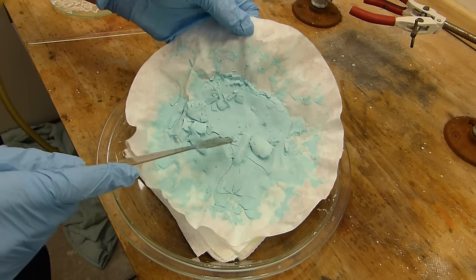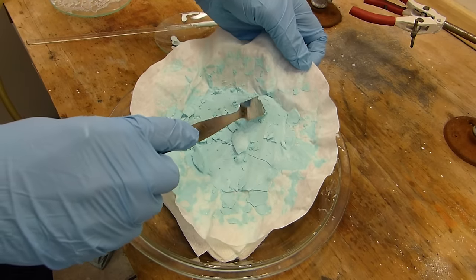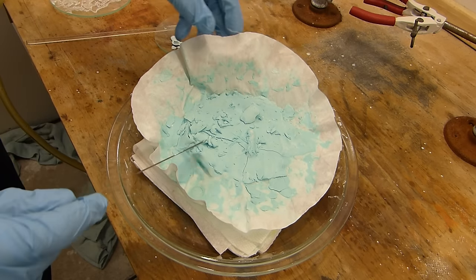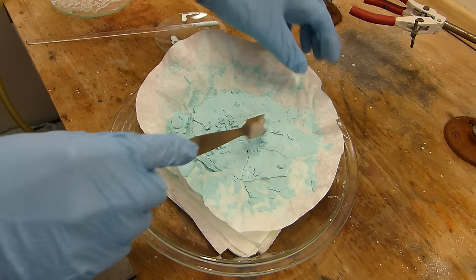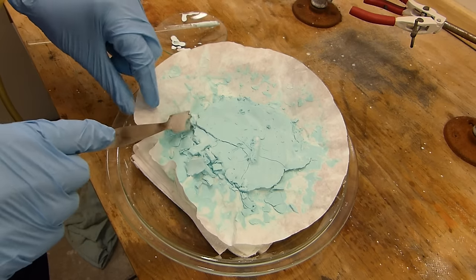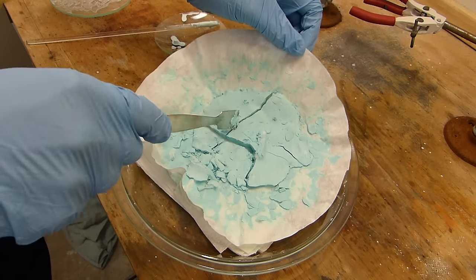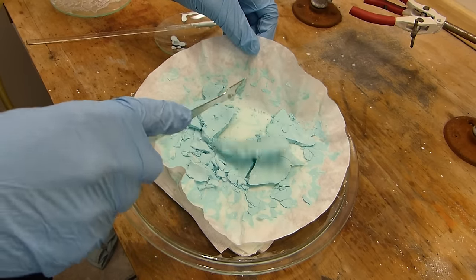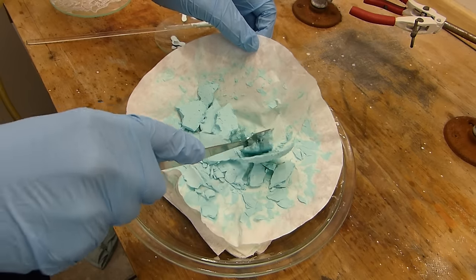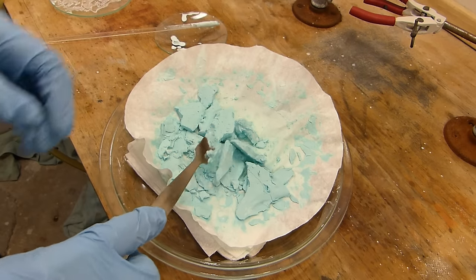Well it's been about 24 hours and this is the product. You can see it's crumbling as I pick up the paper and it's formed a tacky solid. It's still not completely dry but it's going to be forever to dry like this if I don't increase the surface area, which is easily done by simply breaking this up and picking these pieces up, increasing their exposure to the air. There's a whole piece right there. I don't want to touch it or I'll get it all over everything. But you can see it's a nice big chunk of powder. The more it dries the more crumbly it'll get and then it'll eventually be able to be powdered. So I'm just going to break this up and I'll put this in a separate dish so that it might dry a little bit faster.